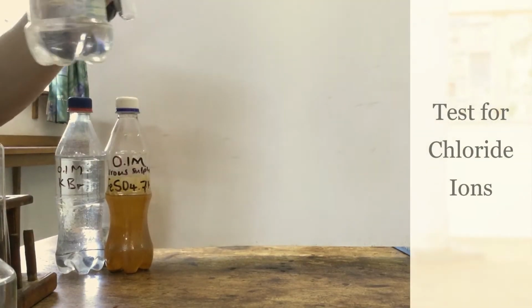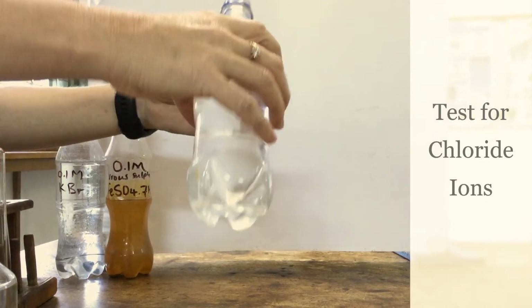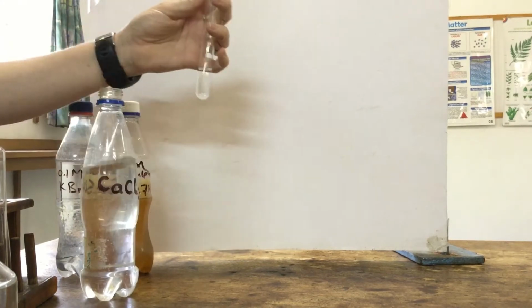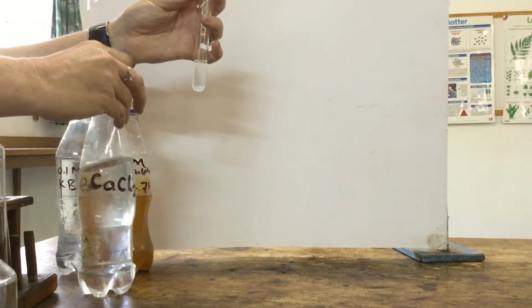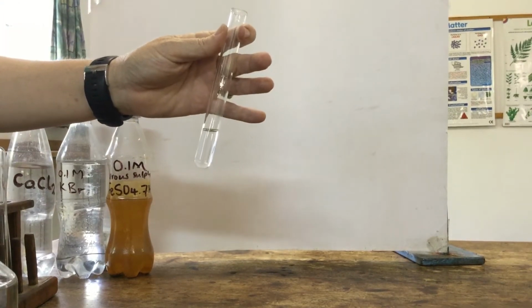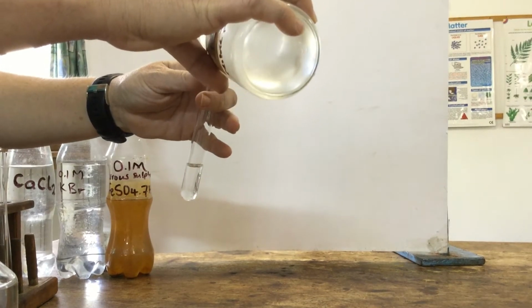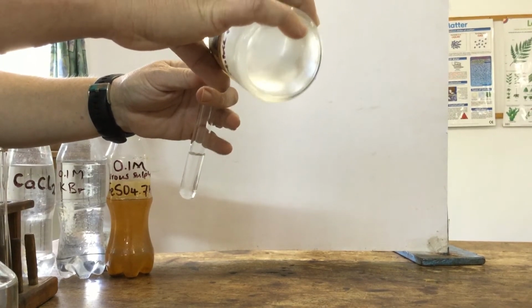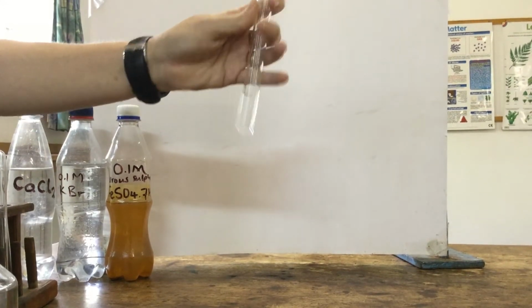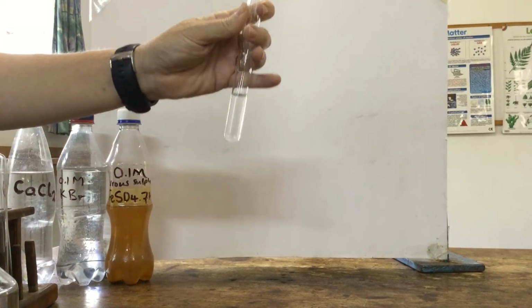Okay, so for the next test we have chloride anions. So here I have some calcium chloride. I'm going to add about 2 or 3 cubic centimeters of calcium chloride to a test tube. And in this analysis we need to acidify first with nitric acid. This will remove any ions that may cause a precipitate, like possibly carbonate ions. Okay, so we've added some nitric acid, and we then add silver nitrate.